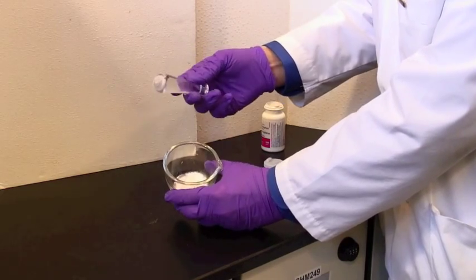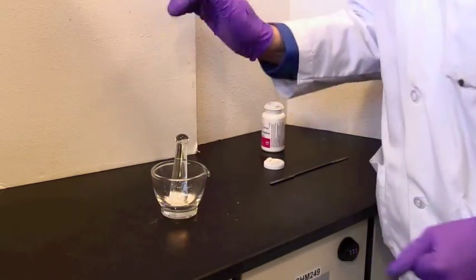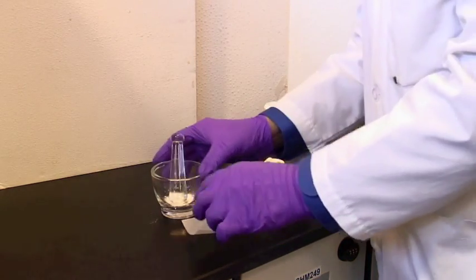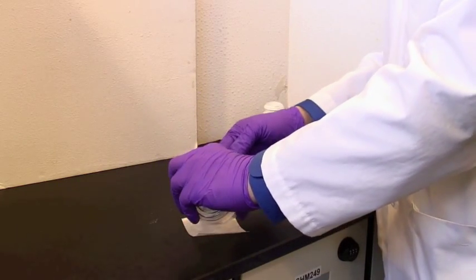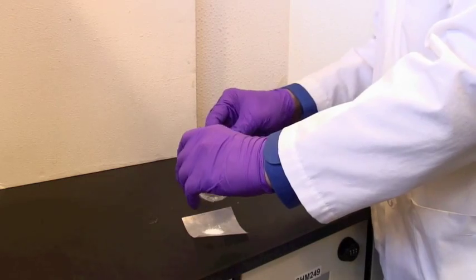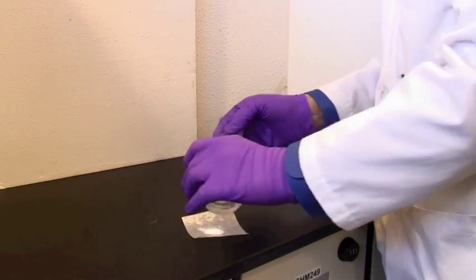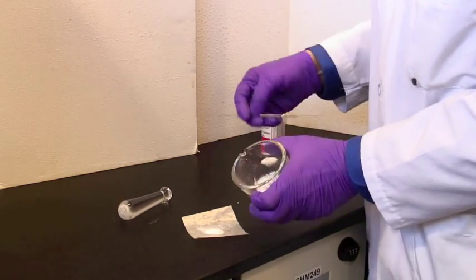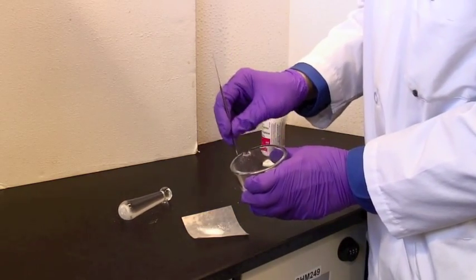When you are transferring away from this, I'll transfer this onto a weighing paper. It will pour out of the spout. However, you will almost certainly still have some solid left.